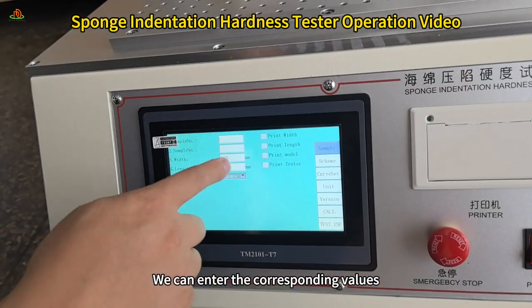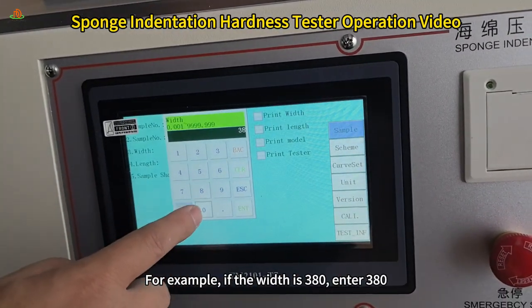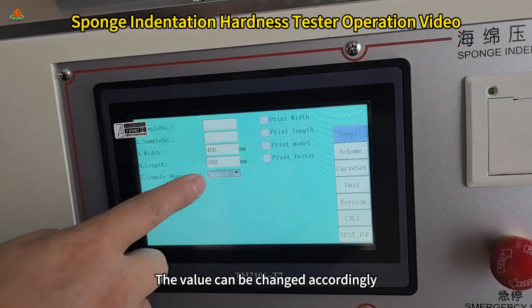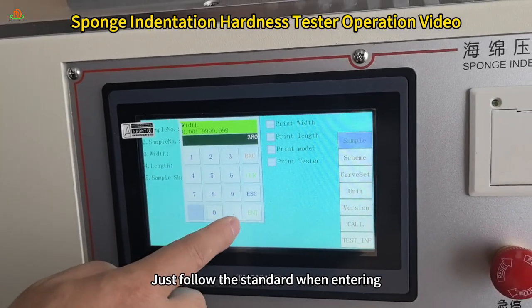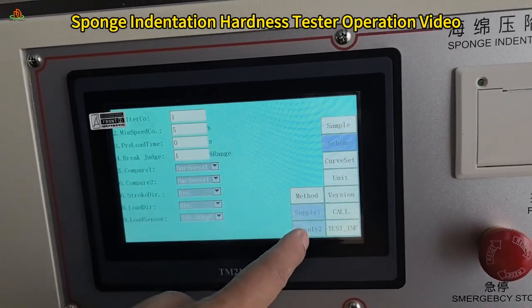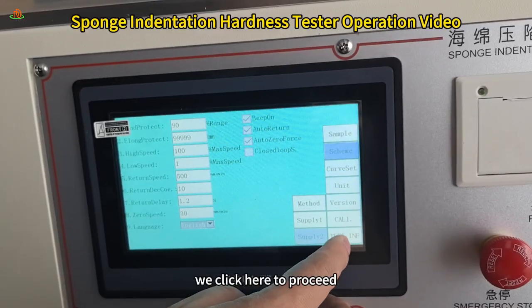We can enter the corresponding values. For example, if the width is 380, enter 380. If it is 400, enter 400. The value can be changed accordingly. Just follow the standards when entering. After entering the corresponding values, let's take a look here. Once all settings are completed, we click here to proceed.